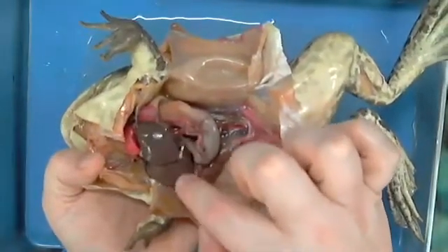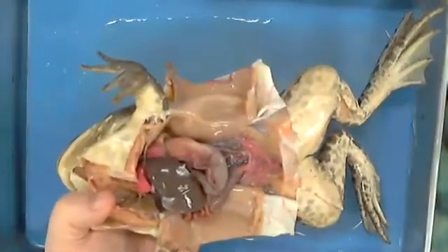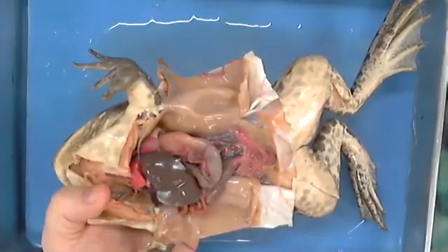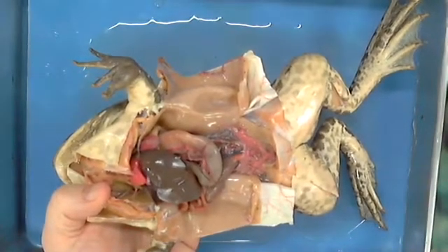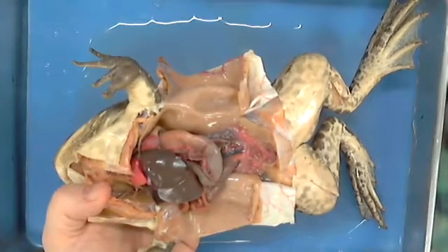All right, so everybody take a look now, and let's see, what do you think about this big dark organ? Liver. So you've seen chicken liver, and it's dark, and there's a reason. Why on earth would our liver be so dark? Because it filters. Because its only job is literally to filter out trash.